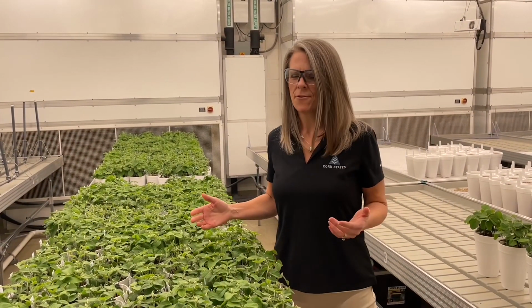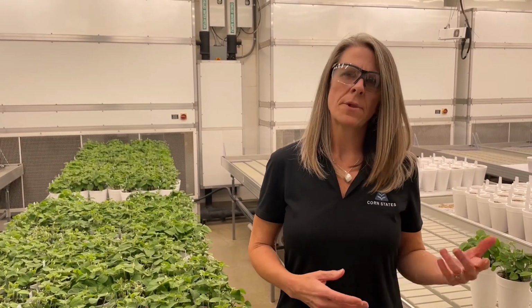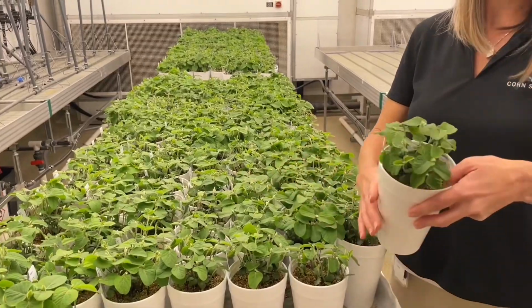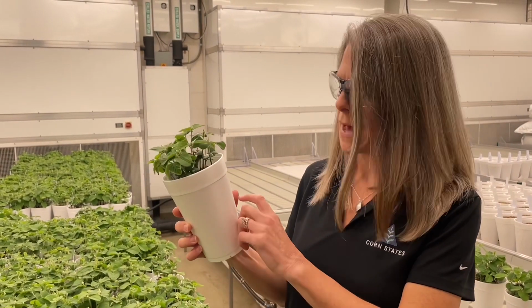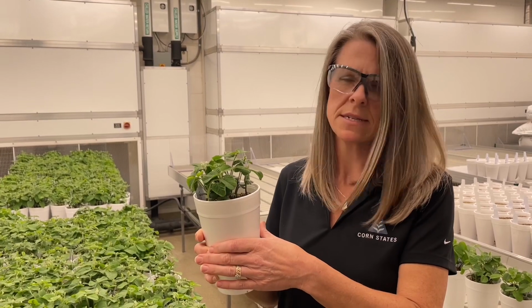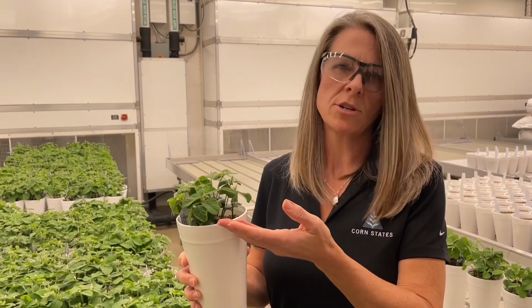So for our Phytophthora field tolerance testing here in the growth chambers, what we want to do is mimic, to the best of our ability, what a plant might be facing in the field if it encounters Phytophthora. So we grow these directly in our cups. We use a layer method. So we plant with a soilless media to a measured amount in the bottom. We're going to cover that with a completely infested plate of the pathogen. We're going to add more growing media, and then we're going to plant on top of that.